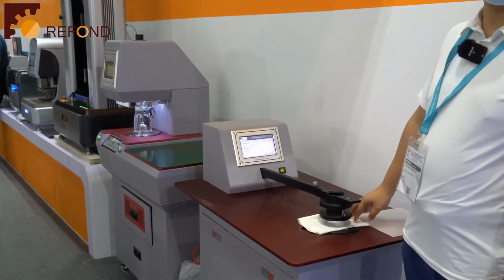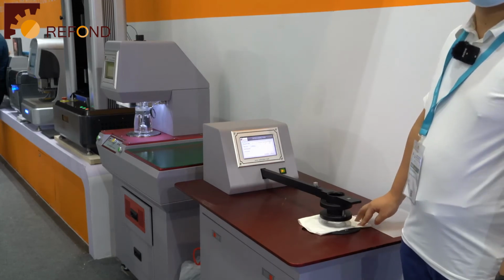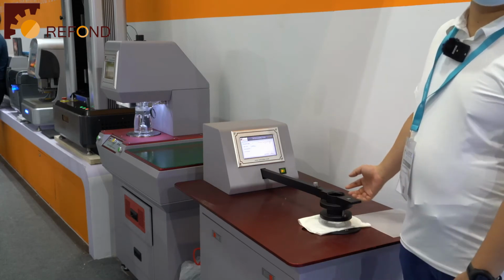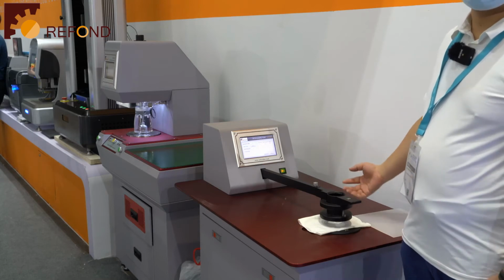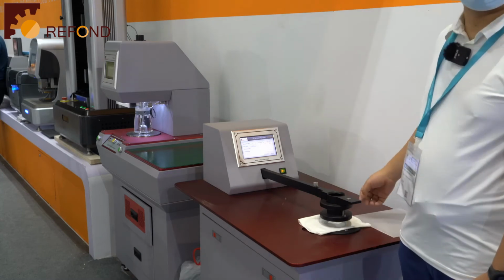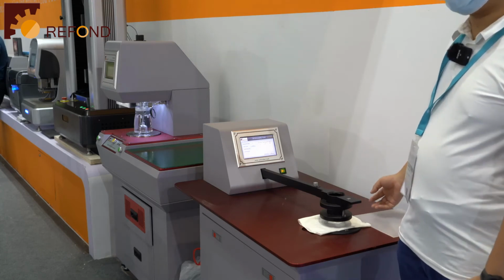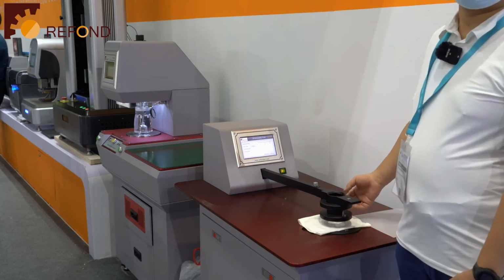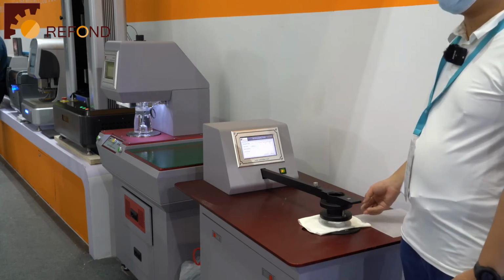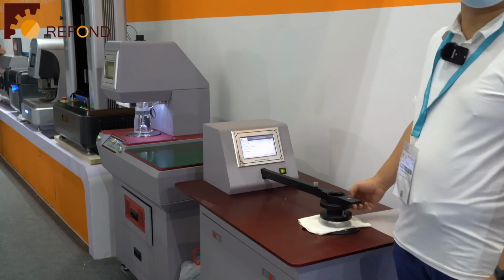The most important innovation for our new machine is that you can use an external calibrated airflow sensor or an airflow meter to calibrate the airflow for this machine. This produces better traceability than the traditional method for calibrating. The traditional method of calibrating requires different sets of plates, which is labor intensive, and it also cannot provide a lot of traceability. Now we can use flow rate meters to calibrate this machine.